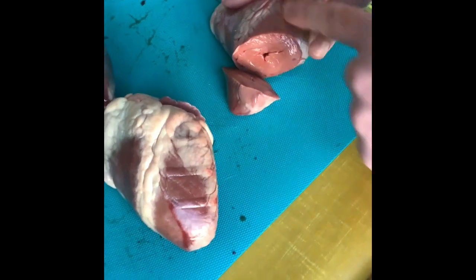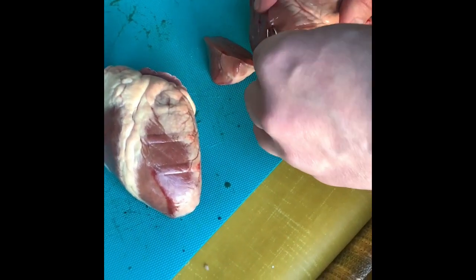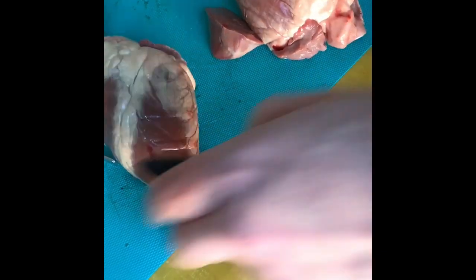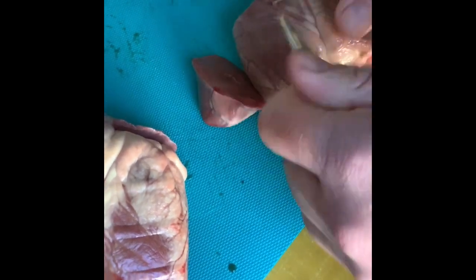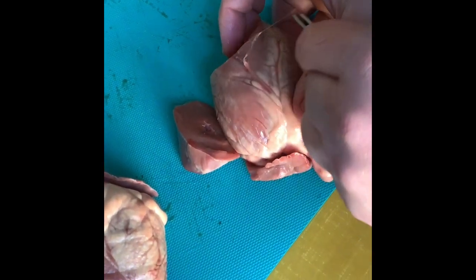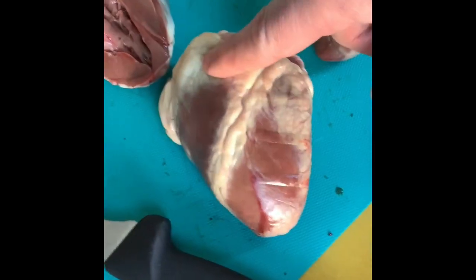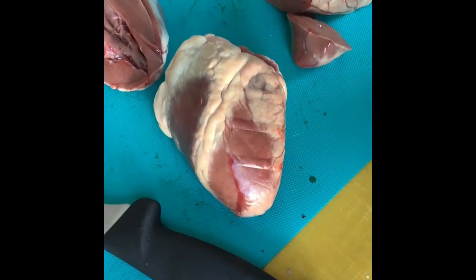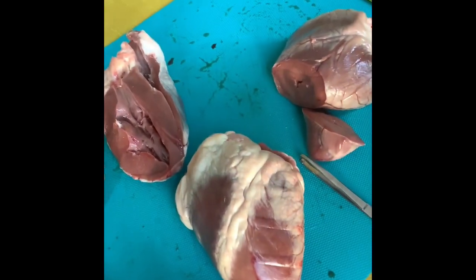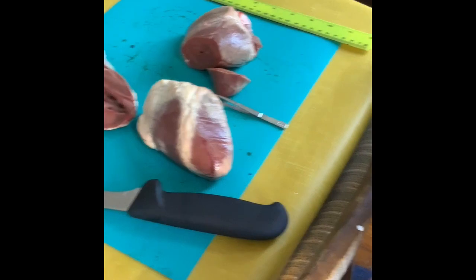You can see the outside of the heart is shimmery and shiny, but it's a bit duller on the inside. That's because there's a membrane surrounding the heart called the pericardium. Let me try to peel it back — can you see that? All organs are surrounded by a membrane and a bit of fat, which is called visceral fat. Every organ has some, but it's very dangerous if you have too much. So that's a whistle-stop tour — hope you enjoyed it, and we'll be back for some more heart fun soon!